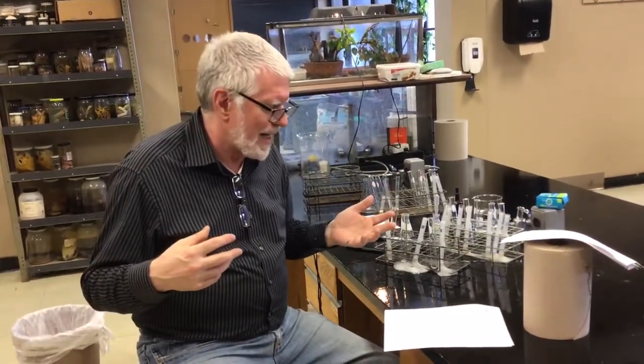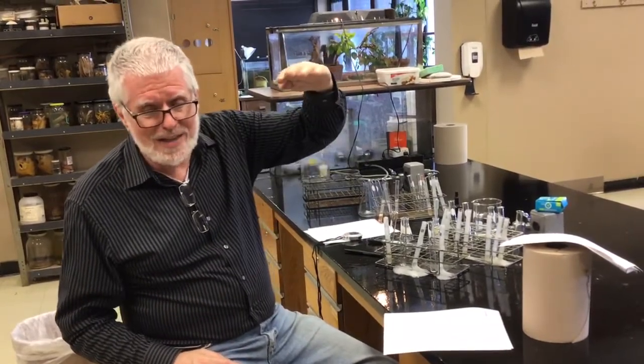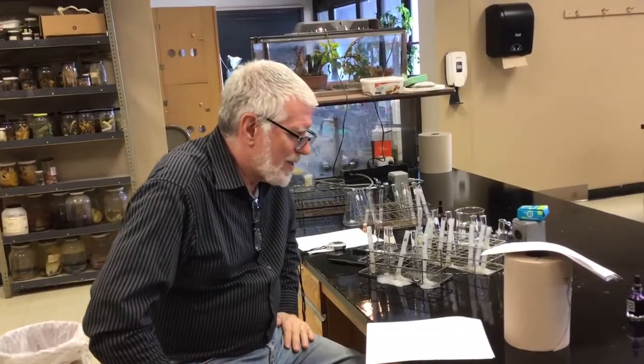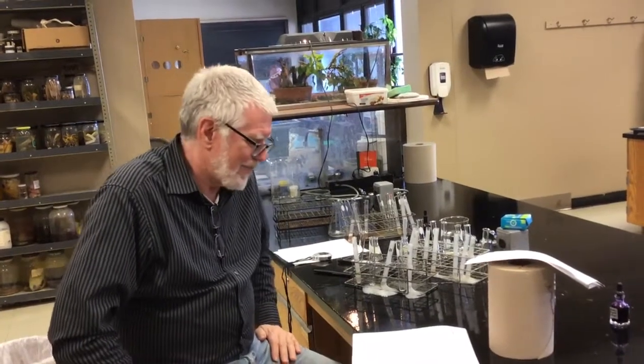I put this lab together looking at a bunch of versions that other people have used, and in some other versions, instead of measuring to a point on the test tube, they use really tall test tubes and much weaker solutions and measure how high the bubbles go. Now, question 2 is, do you think that's a proper measurement? And if you do, why? And if you don't, why?